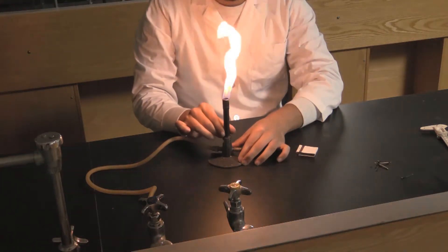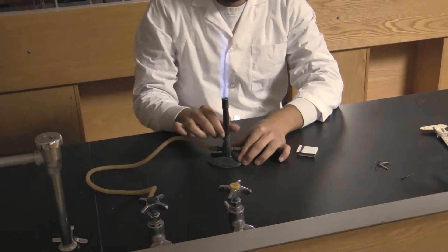Conversely, opening the barrel too far will introduce too much air for the available fuel, and your flame may extinguish.